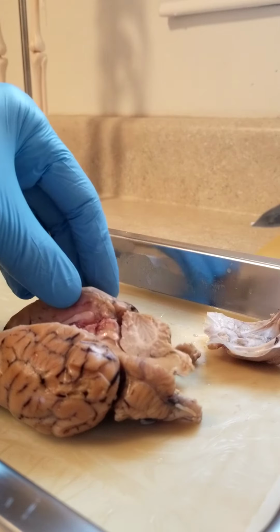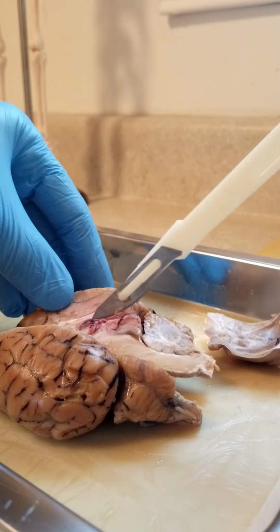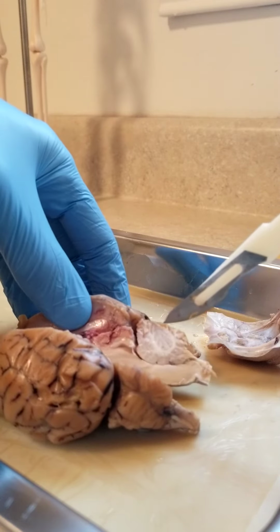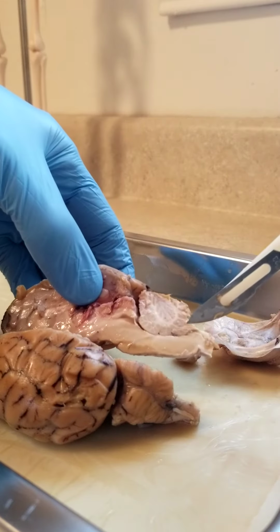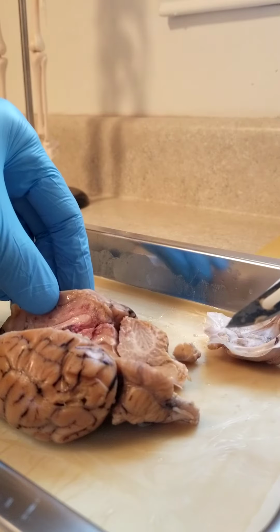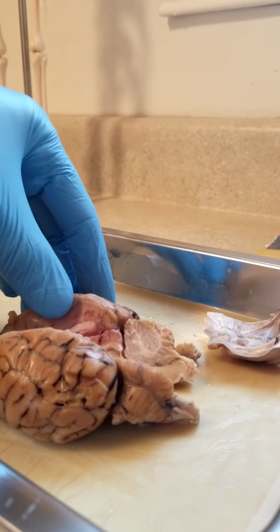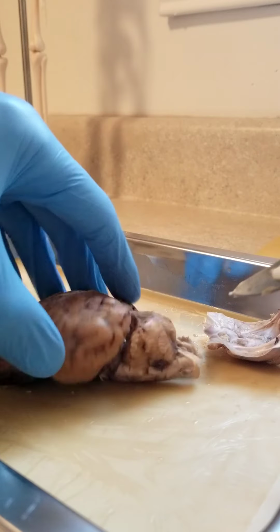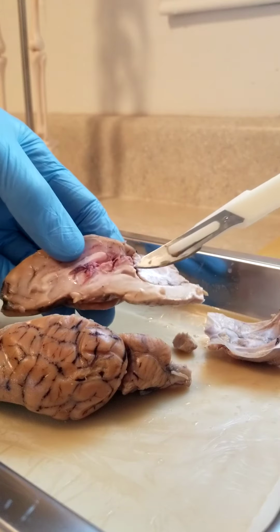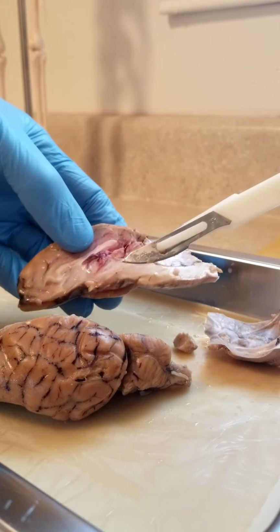Now we go to the brain stem. It goes all the way down the middle. Hopefully this is a good view here. All the way down here to the spinal cord. Midbrain, cerebral peduncle. Peduncle is always a weird one to say. That's your underneath middle area there. Next to the superior colliculus. And then you have your inferior colliculus as well.